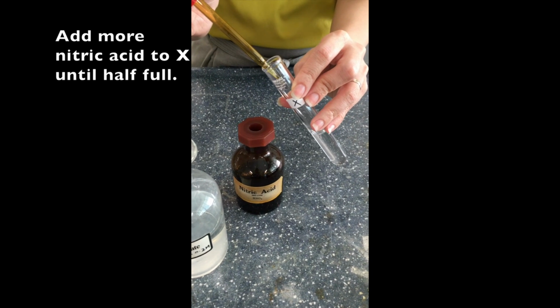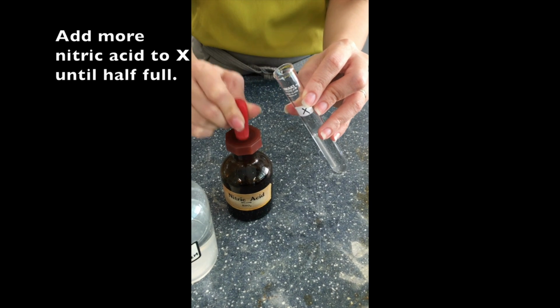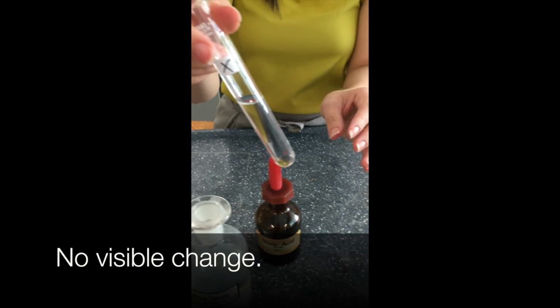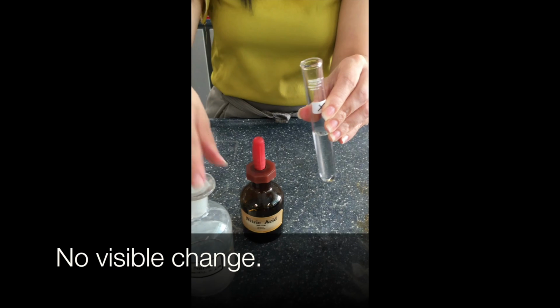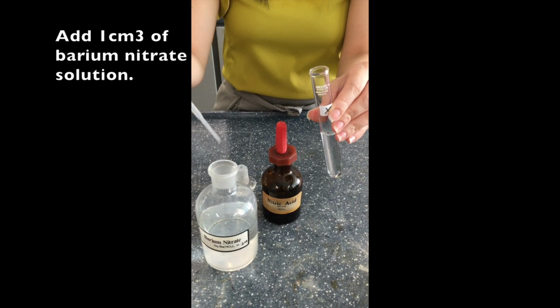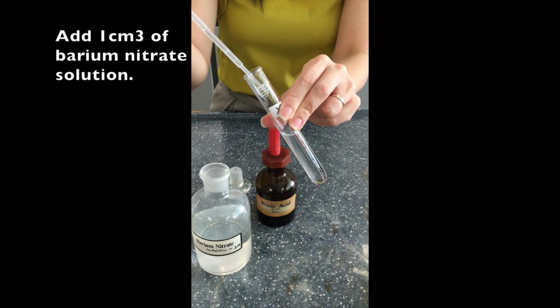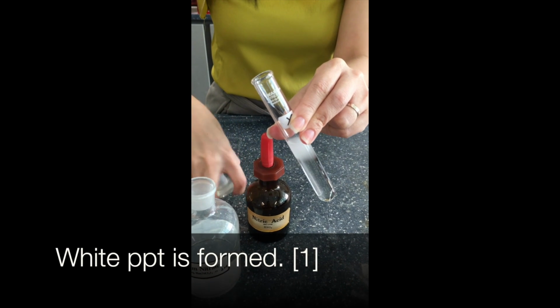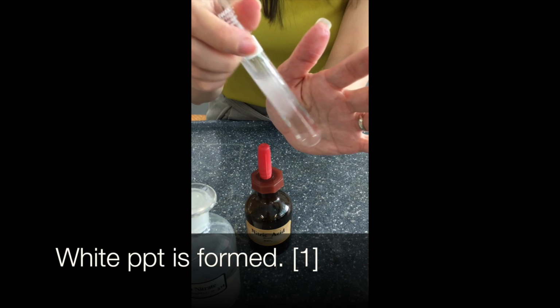So here we are doing it for test tube X, where we add more nitric acid to X until half full. So at this point, we see that there is no visible change as we are adding nitric acid. Then when you add the barium nitrate, you can see that there's white PPT and you need to shake the mixture.